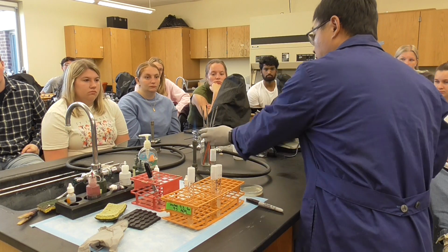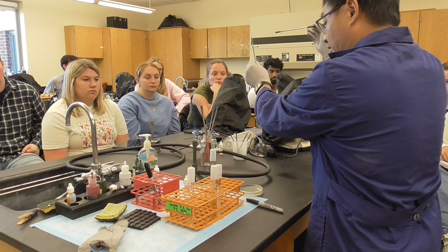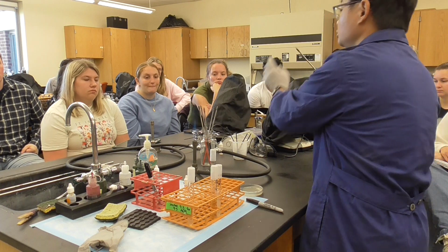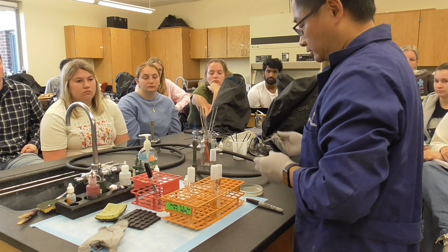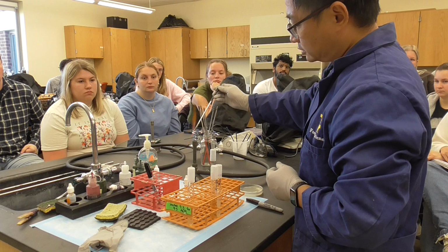Sometimes you will see something like this. This is called a needle. It will be used in a later lab for the sulfide indole motility test, but not today. So make sure you have a loop on the top. Okay, now the first thing is sterilization. Make sure the whole thing is red and a little bit here.